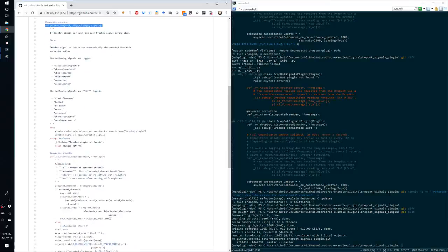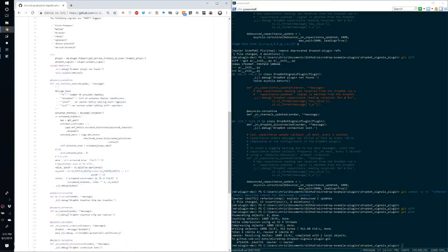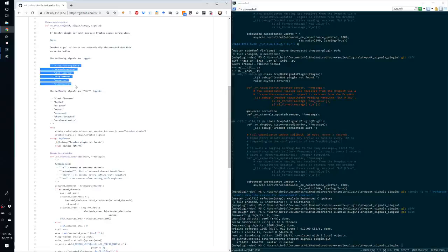in a protocol in MicroDrop, it attempts to look up the DropBot plugin if it is currently installed, and if it can successfully find the DropBot plugin, then it creates a reference to the corresponding DropBot signals to use locally. If any of this fails, then the step will just be marked as completed and a message will be logged indicating the DropBot plugin wasn't found. Otherwise, the idea is that we will connect to all of these signals and simply log a message indicating that the signal has occurred.